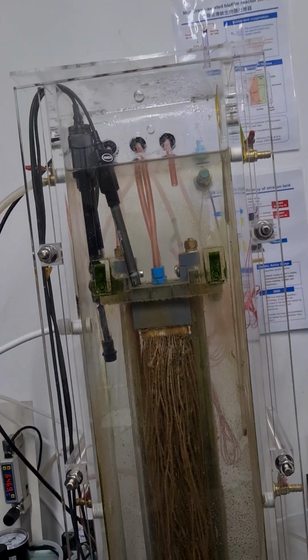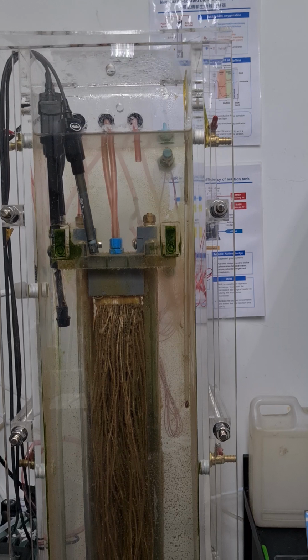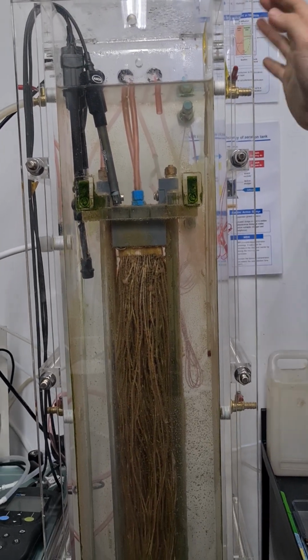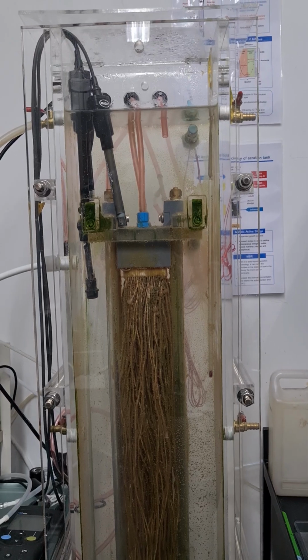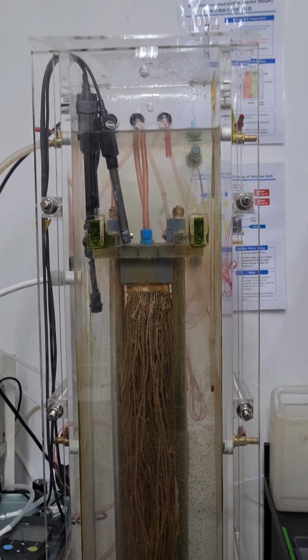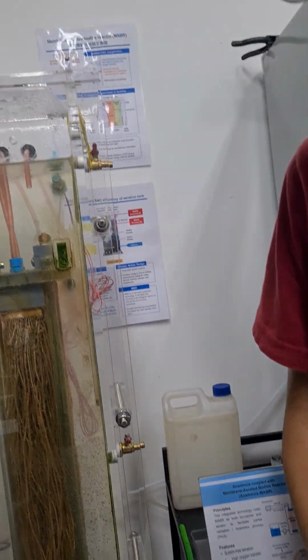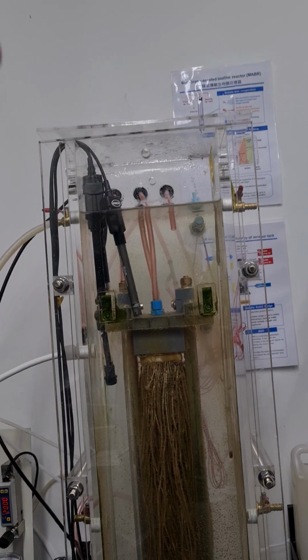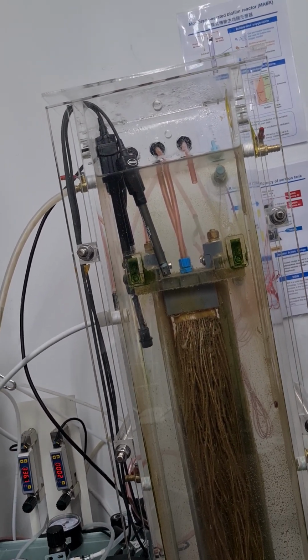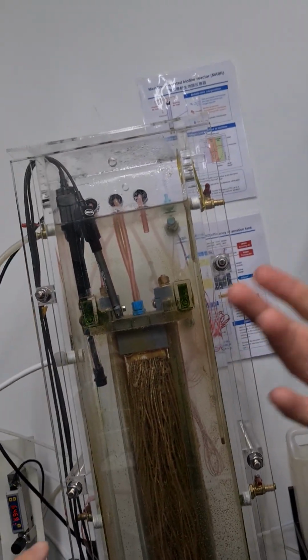For us, we didn't decide to put too many modules inside the reactor. So you mean most of the space is occupied by membrane in your lab? Yes, everything. We have influent passing through the membrane, with a small space, and then it goes outside. I understand.